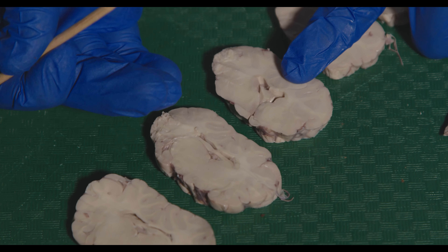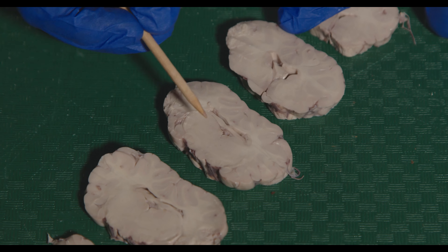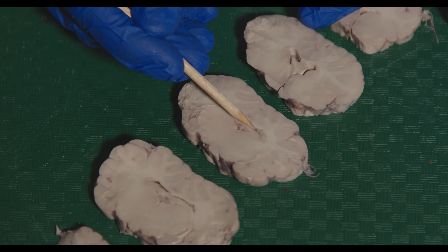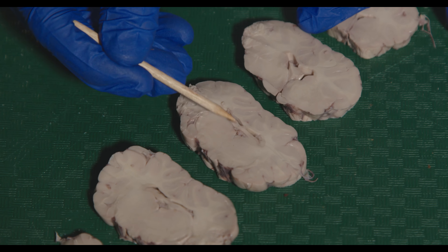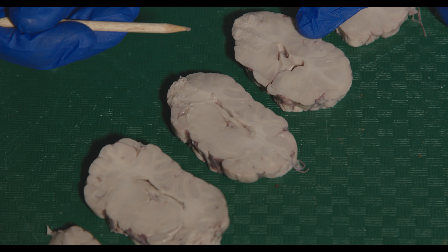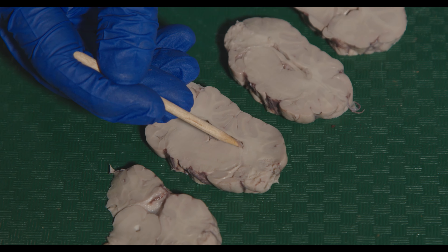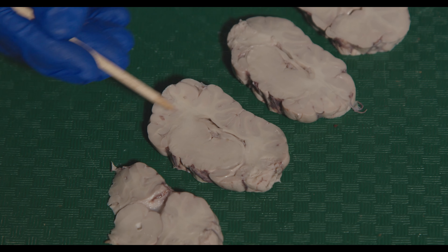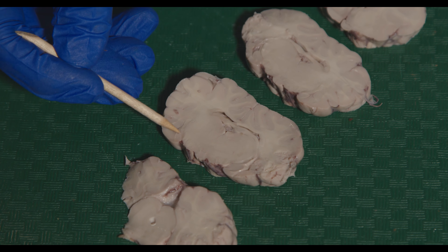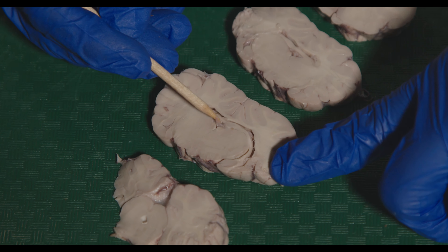Going even further back, the basal ganglia structures get pushed to the edges and this giant structure here is the thalamus. You can still see the corpus callosum connecting the hemispheres, and you can also see the fornix — the major output of the hippocampus. Going a bit more caudal, we can start to see the fornix forming into the hippocampus. The hippocampus has a seahorse shape and wraps around — you can see it wrap around and then there's a ventral portion here. You can see how it wraps around and then comes up to form the fornix.